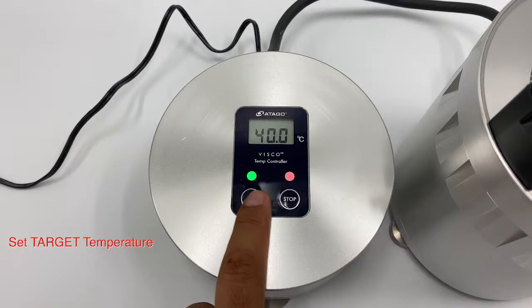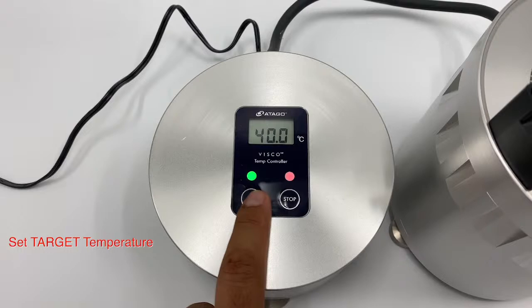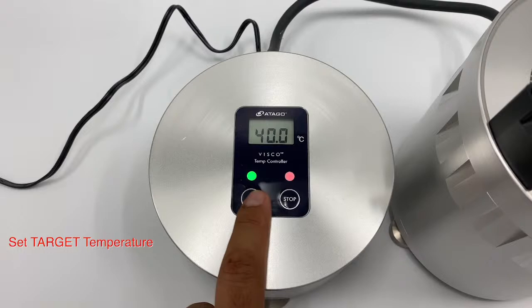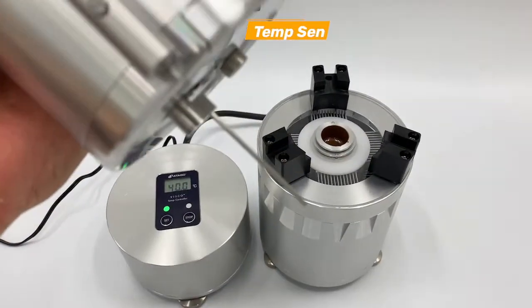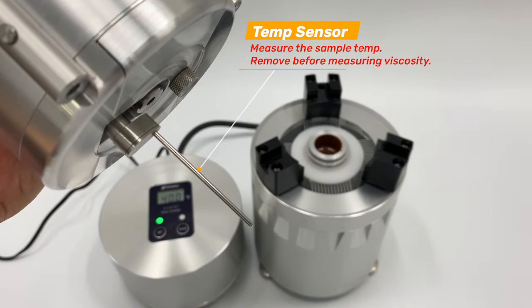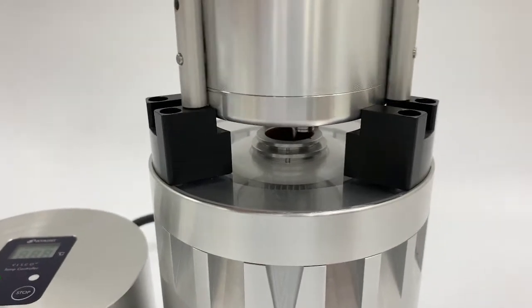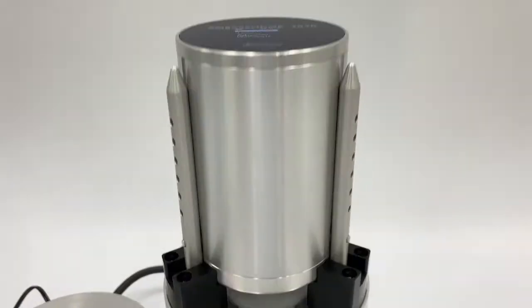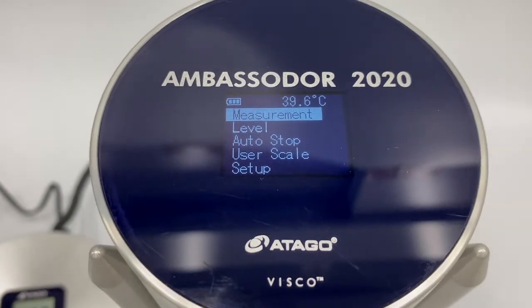Chocolate is normally tested at 40°C, though depending on the product and internal procedures, some are tested at 30°C or 50°C. Here we're setting the target temperature to 40°C. Once the instrument starts heating, we insert the temperature sensor into the sample and confirm the sample has reached 40°C. If the sample hasn't reached 40°C, go back to the controller and adjust until the sample is at your target temperature.